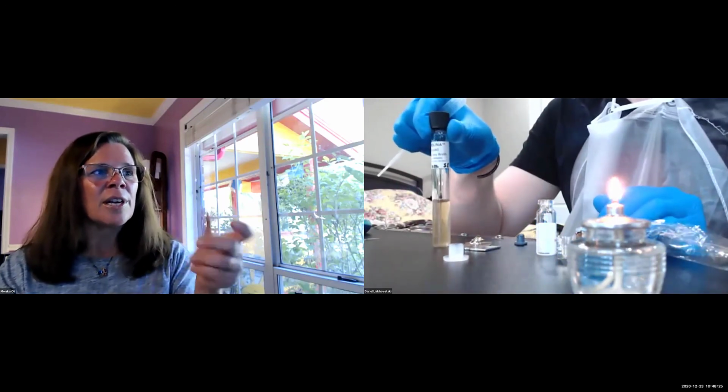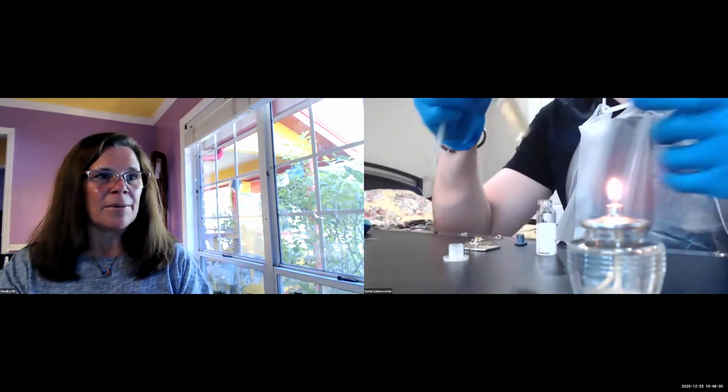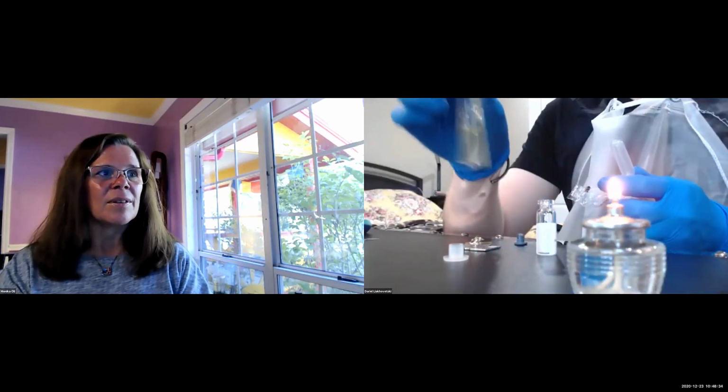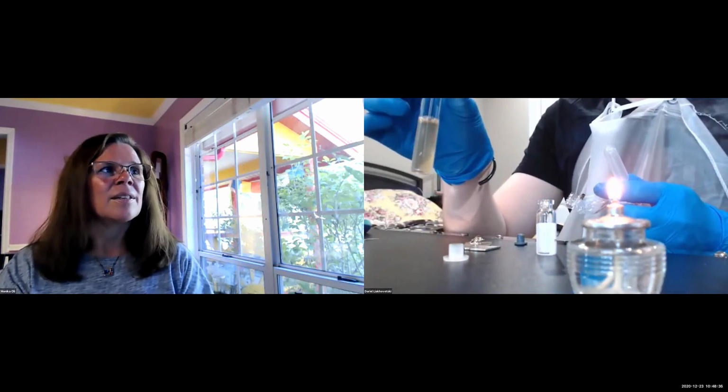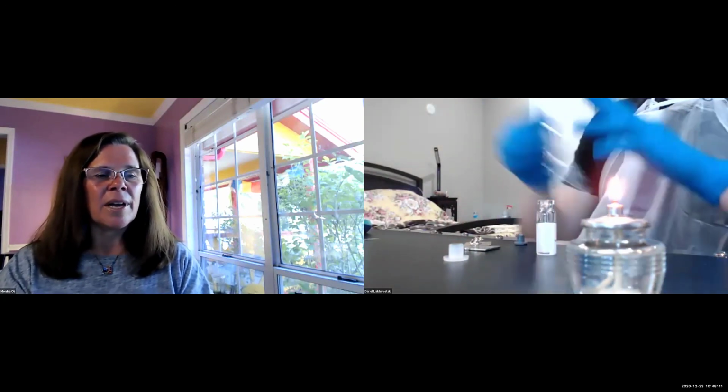Shake it a little bit up and down, and then we incubate it. I will dispose of the pipette that we used. Great. And I will put this to incubate. And we have some time pass.